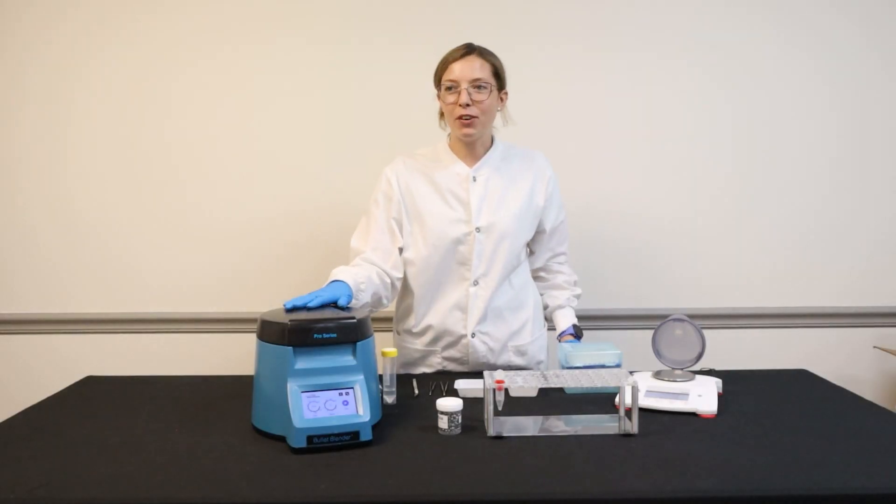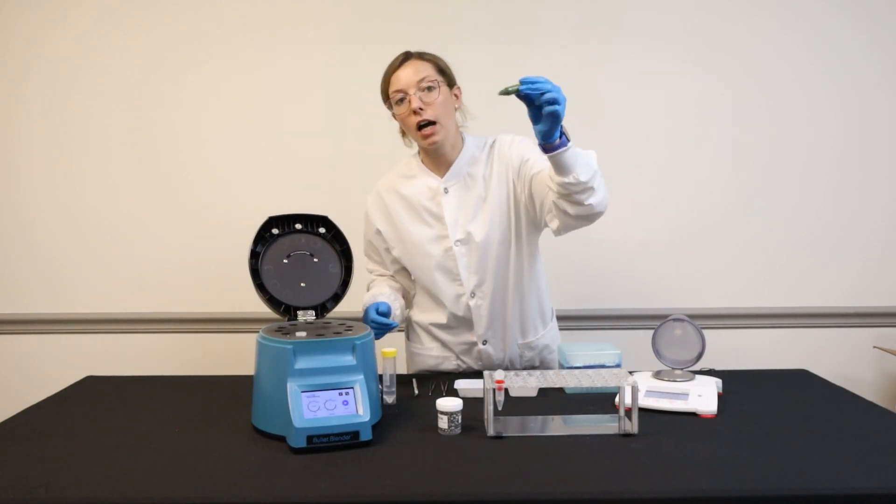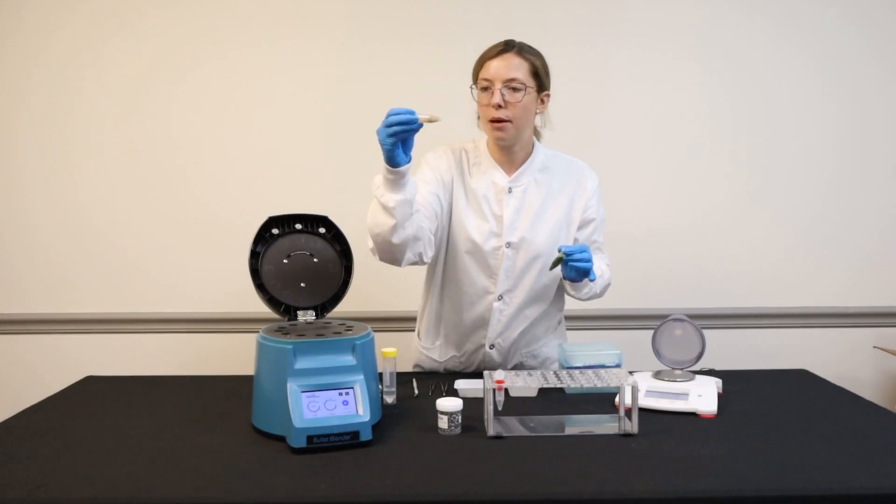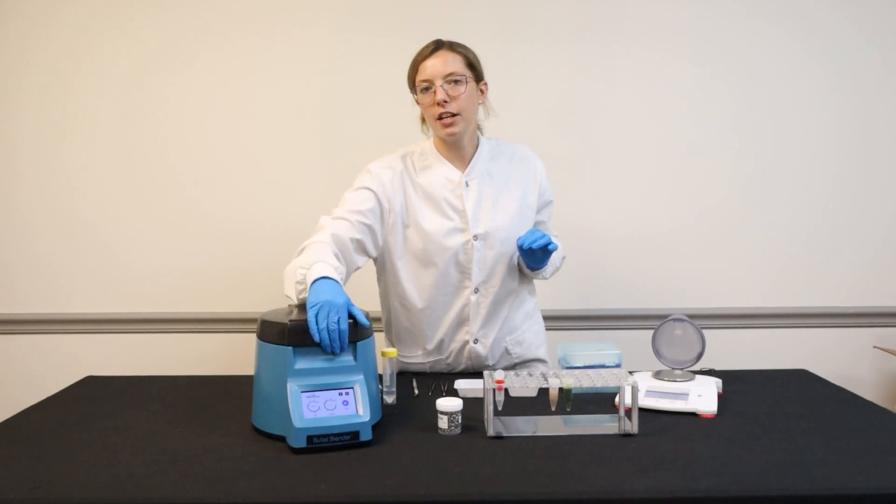Great, it's been three minutes, so it's time to check on our samples. What I'm looking for is a uniform color and consistency with no obvious tissue sample pieces. Both of these look good to go.